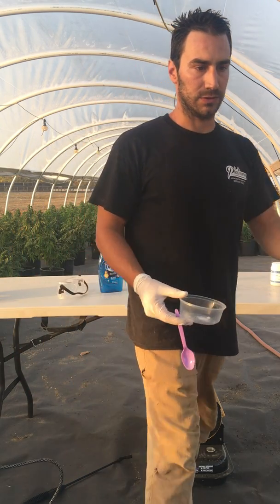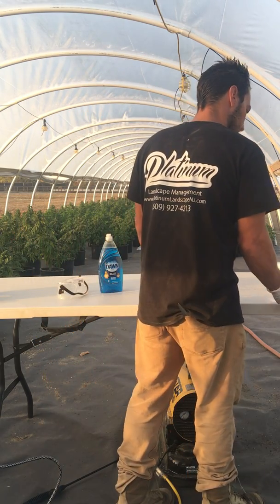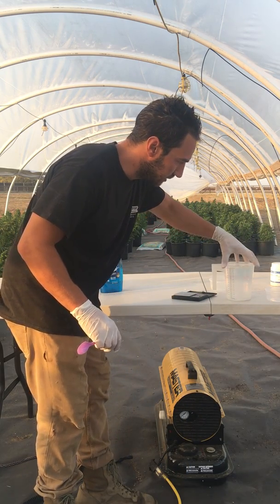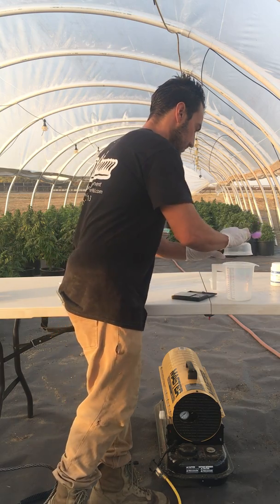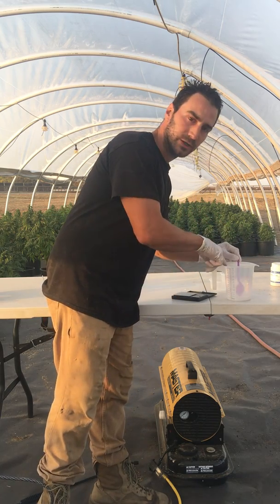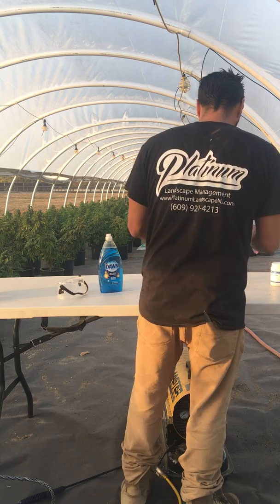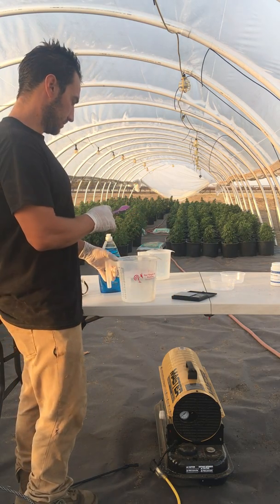This is a method I've done a couple different times and it's always worked for me. I get a lot of male parts and I've really only had to spray it one time to get the results. I've got one gram of silver nitrate here and I'm going to add it into 1,000 milliliters of very clean water. Mix it up really well — make sure the silver nitrate is fully dissolved. I'll call this solution Part A.